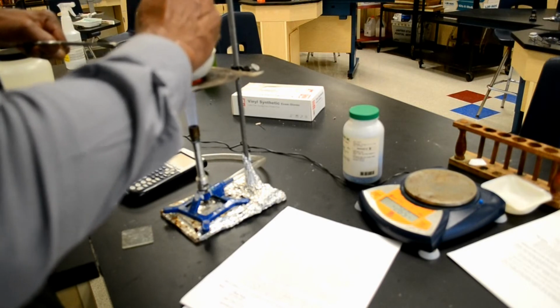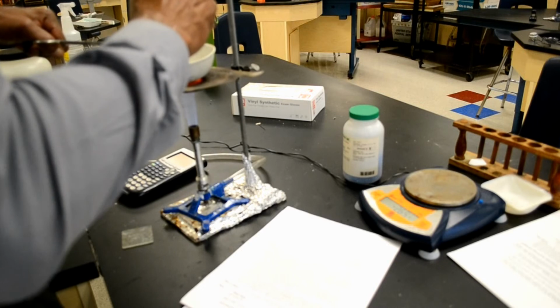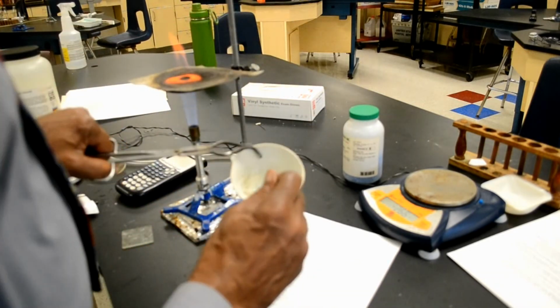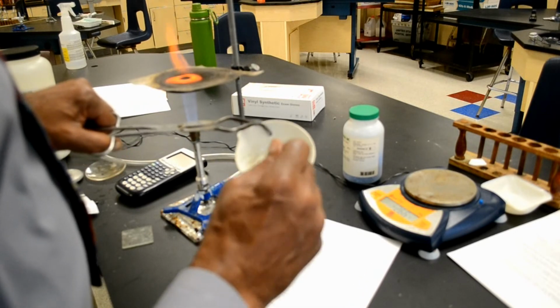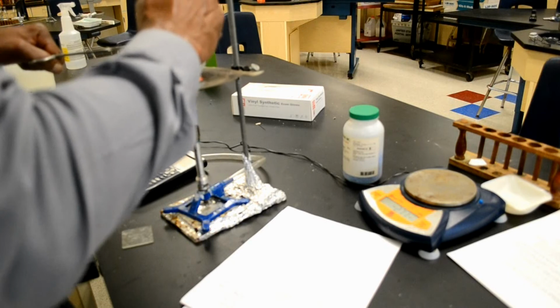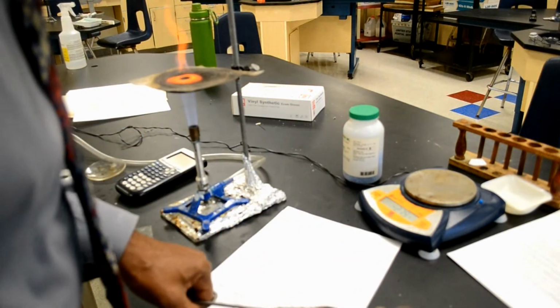And I'm almost done. It's almost there. See, it's pretty much there. We got that much.